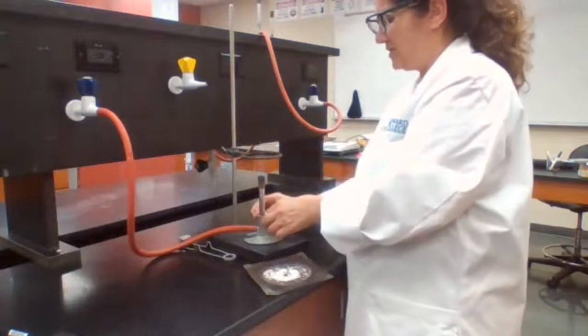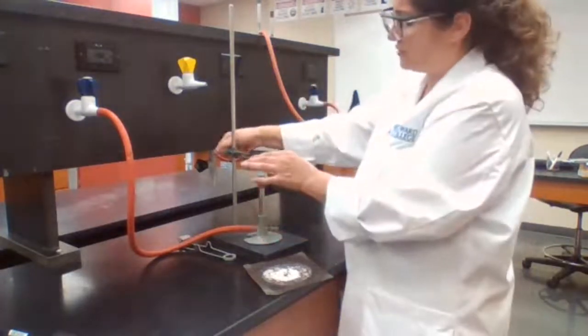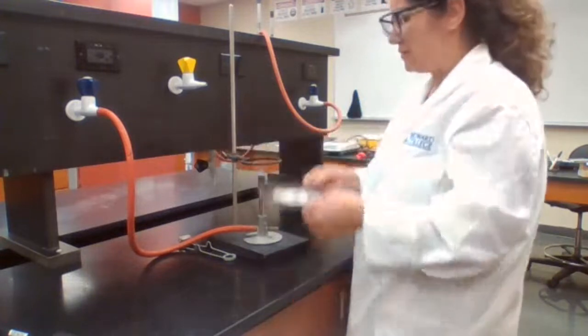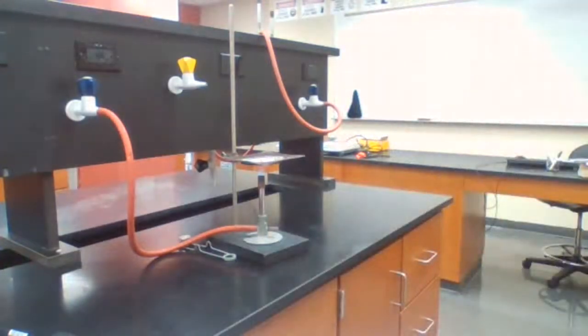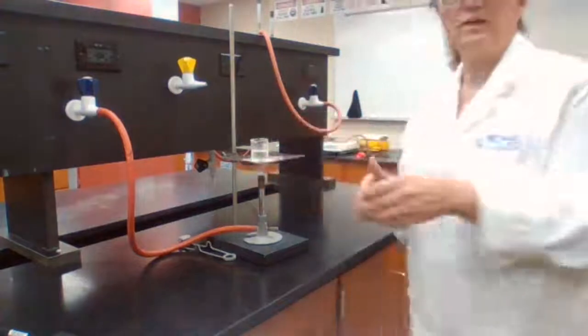When you're setting up the Bunsen burner, you want to make sure that it's not too far up, because if it's too far up, it would take much longer to boil. I find a small heat here. I'm going to use it for the boiling point of the water for the next step.